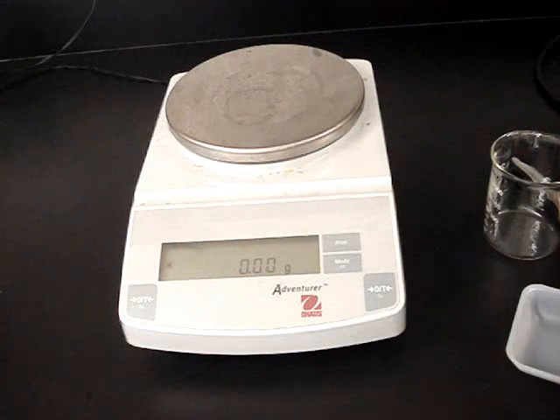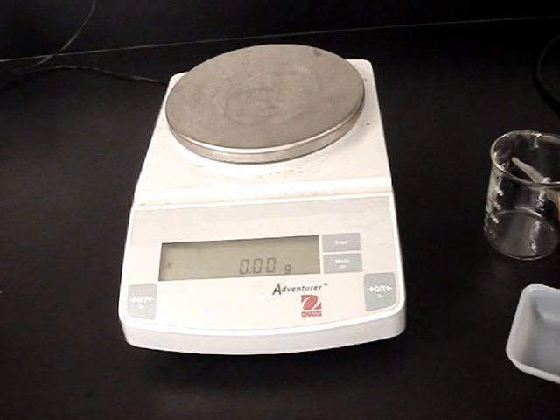The electronic balances that we have are a wonderful piece of equipment to help us measure masses very quickly and very accurately.